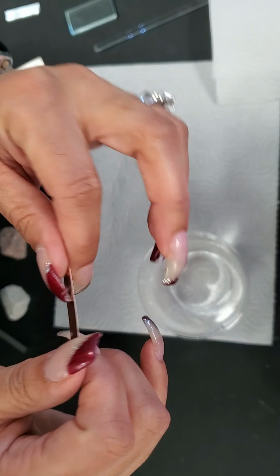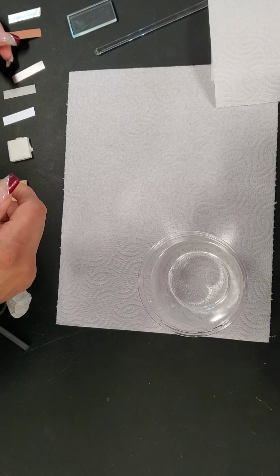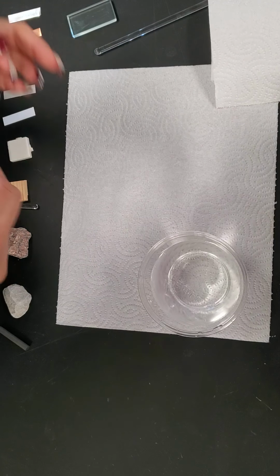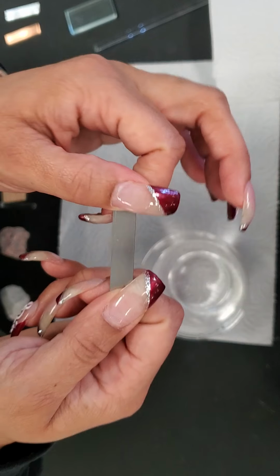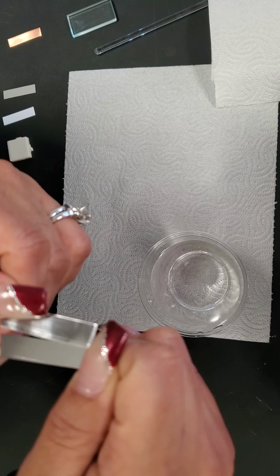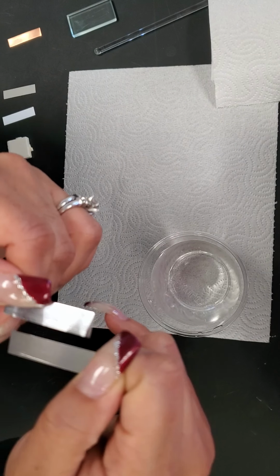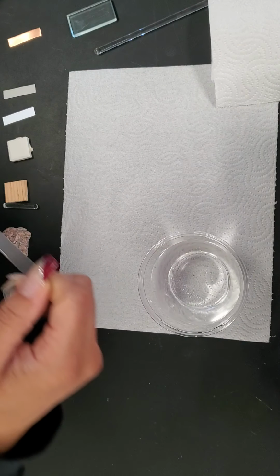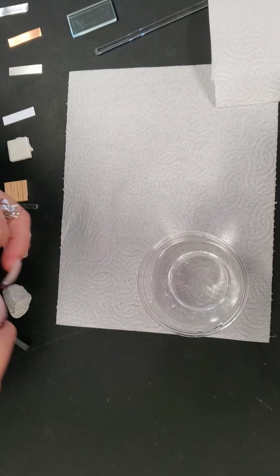It is also shiny, slightly more muted than the first one, but still shiny. This third one here is iron. It is a little bit duller than the aluminum and a slightly darker silver, more of a gray. And it is also somewhat reflective.